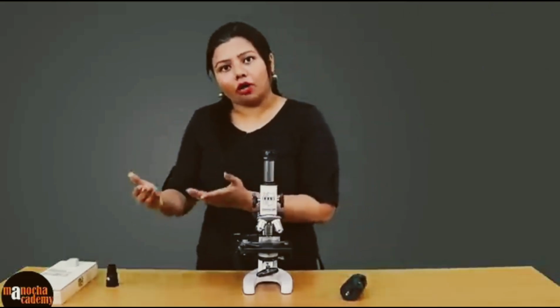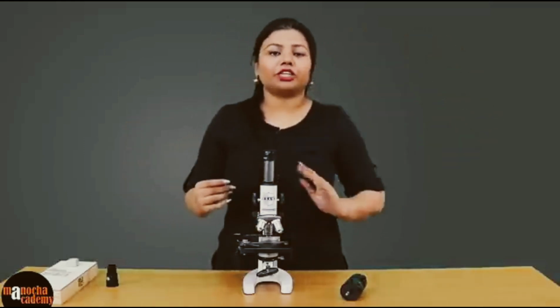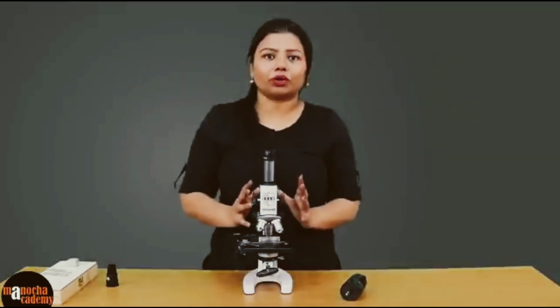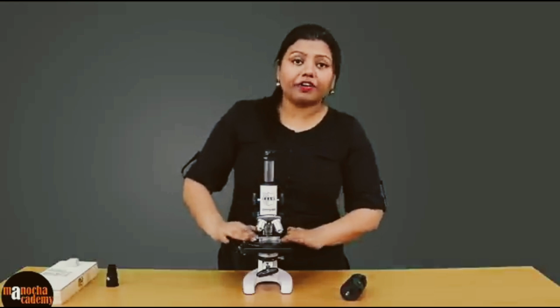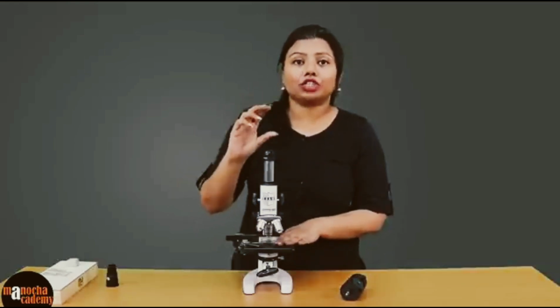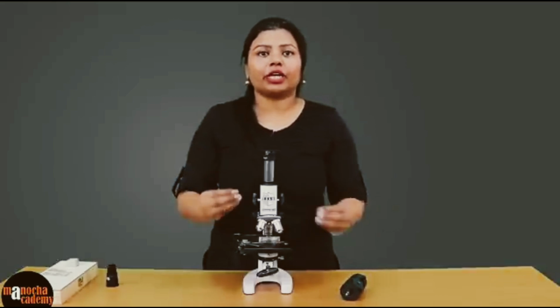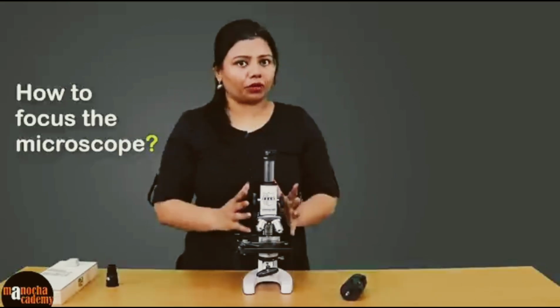After focusing on the object which is near you, you can focus on another object which is further away, but you have to bring that object into the focus of the camera. So similarly here, whenever you are putting a specimen on the stage, you have to adjust so that the specimen is at the focus.